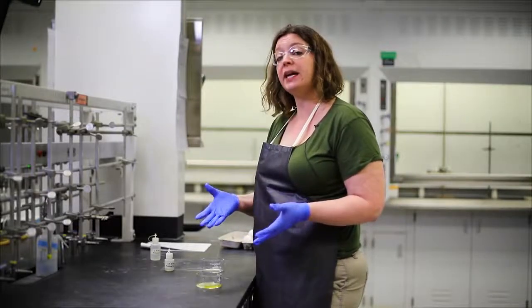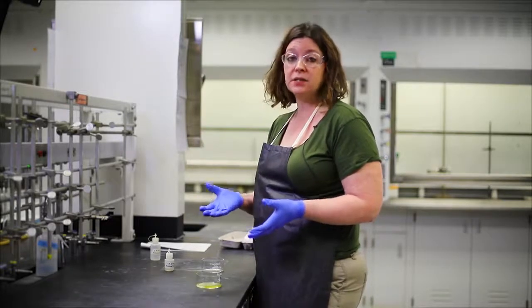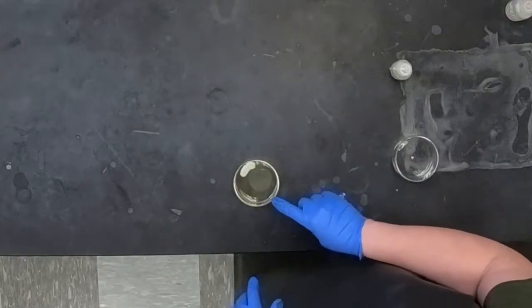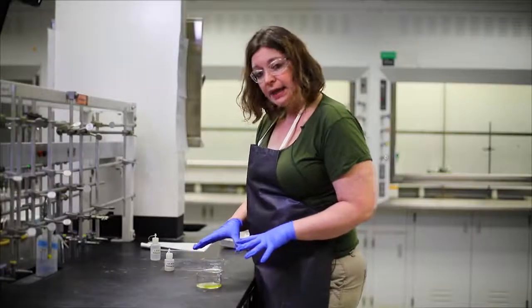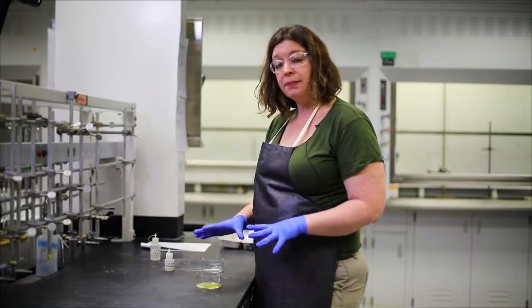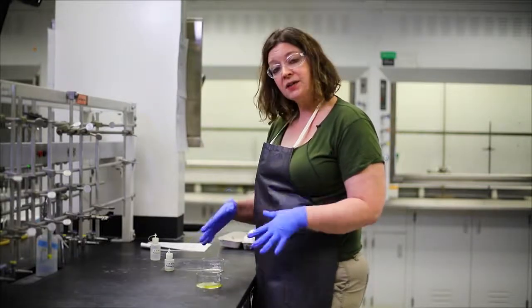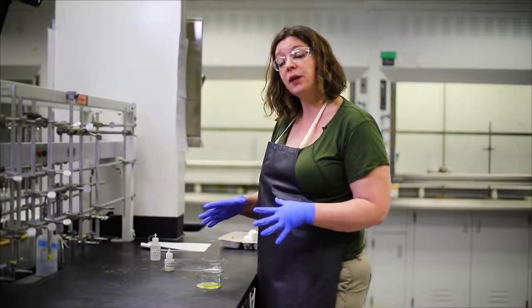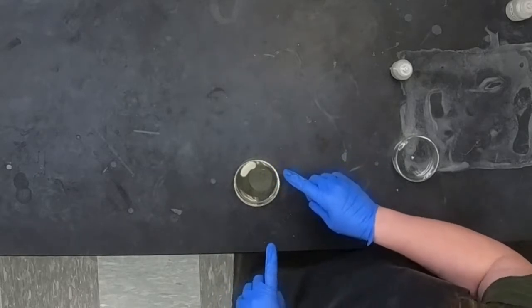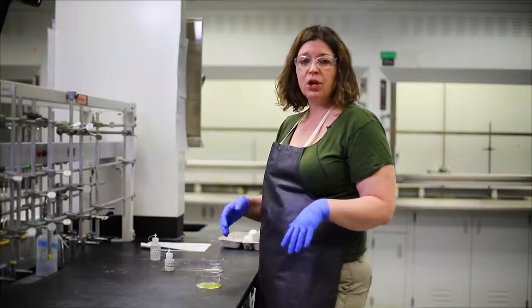With an acid, if you get it on you accidentally, you feel it almost immediately. You almost immediately start to feel it burning. This sodium hydroxide, this alkaline, this base that we dripped on the other side of the egg white, takes a little bit longer. So in some cases, basic substances can be more of a corrosive hazard than acid because you don't feel them right away. So it has a chance to sink down into your skin and cause a bigger burn over time. We're going to come back to this and take a look at it after a couple of minutes have elapsed, because we want you to see what would happen if you just let this burn go.